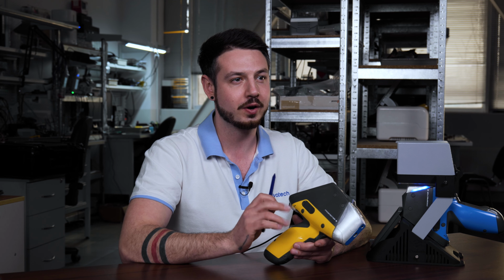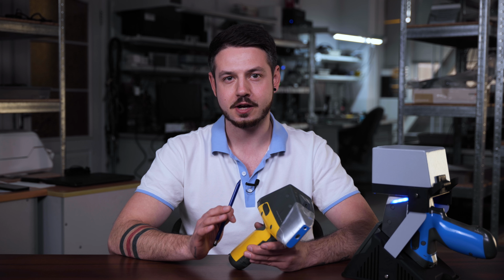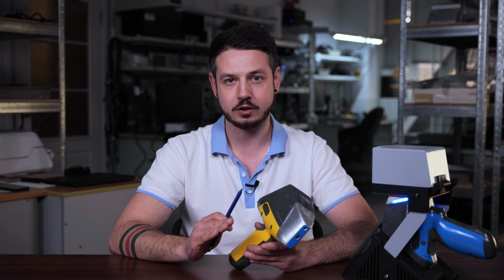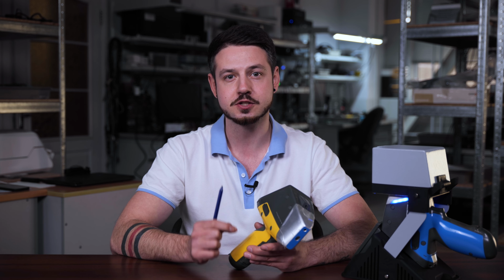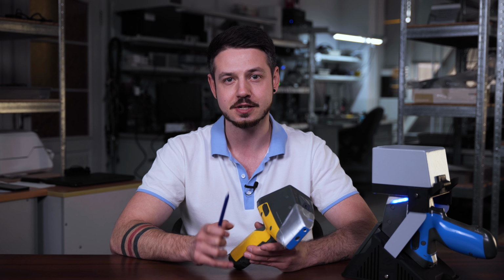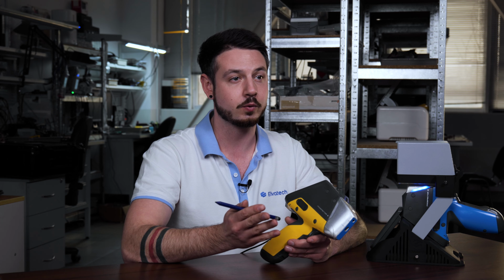However, for more in-depth analysis of the alloy composition, you can set time between 10 or 20 seconds. Choosing the right analysis time can increase measurement accuracy, especially when dealing with complex alloys or when the smallest compositional components need to be identified. This setting is key to ensure high accuracy of the analysis according to your task and requirements.